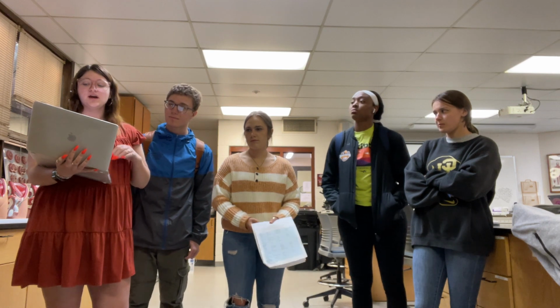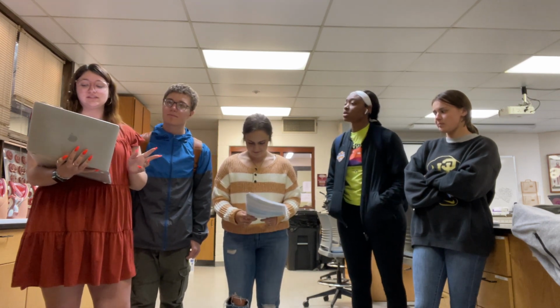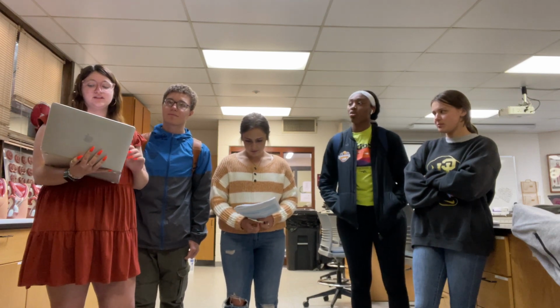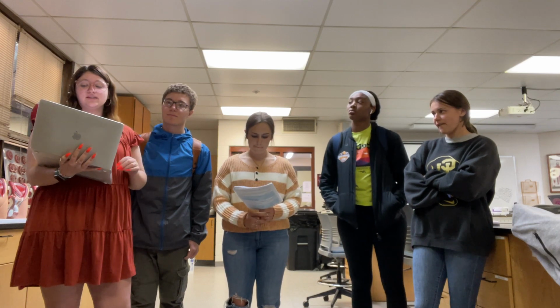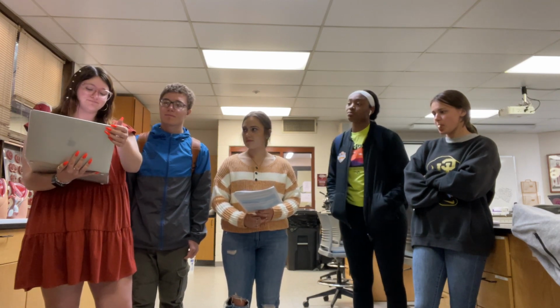the spinal cord. Inside the brain of the perch, there's an olfactory bulb, which senses smell, optic lobe for vision, cerebellum for hindbrain, cerebrum is the main mass of the brain, and then pituitary is for hormones.